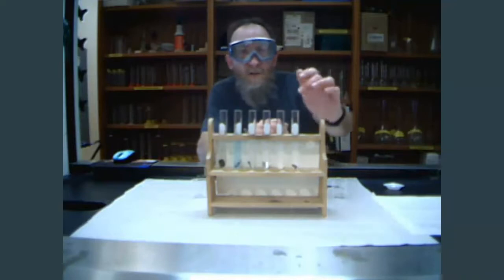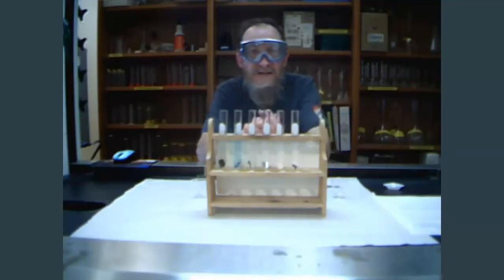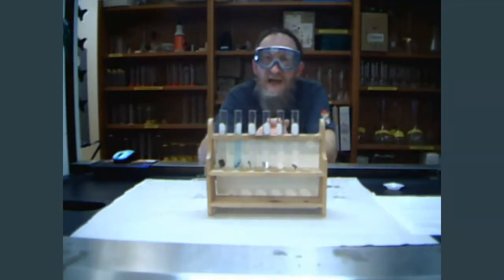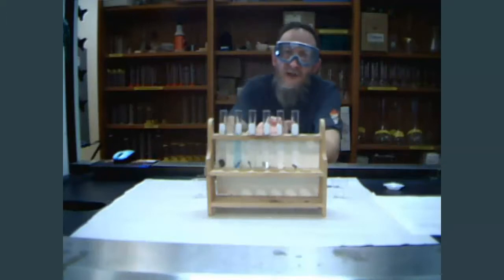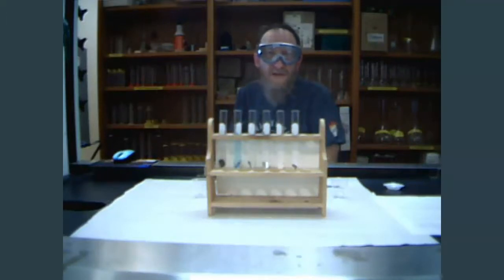But definitely, already, we can see in this last test tube, test tube number six, an evidence of a chemical reaction. There are bubbles going on in there. And it appears that the zinc is turning more of a blackish color. So let me move the camera.